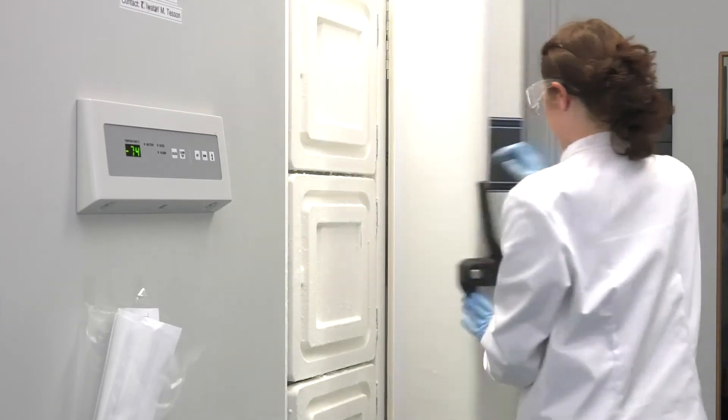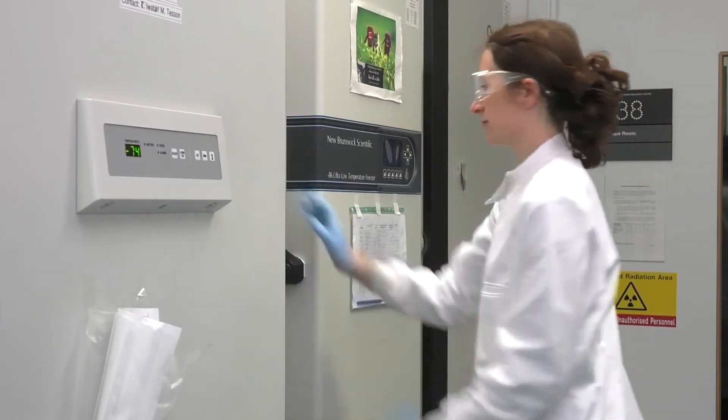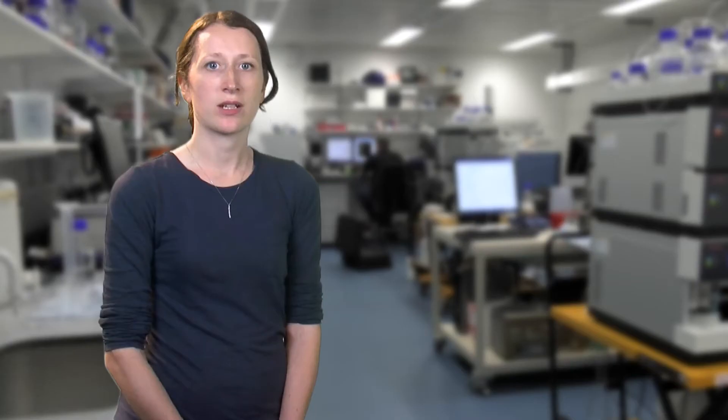There are many variations on this basic protocol that you may wish to make, but please, always ensure that your cell pellet to extraction solvent ratio is the same, as this is the only reliable way to normalise total metabolome content between samples.